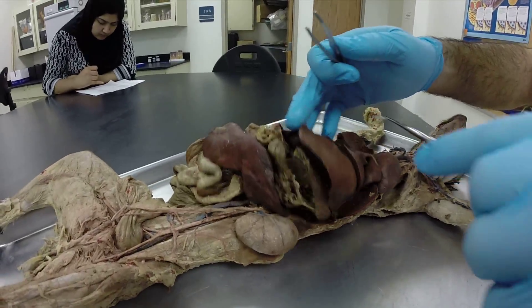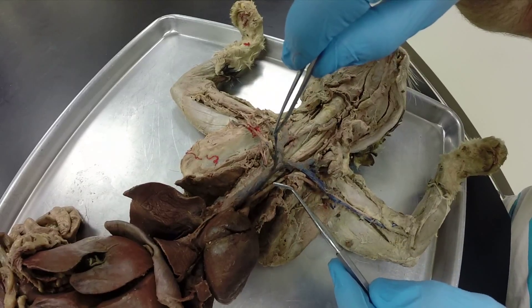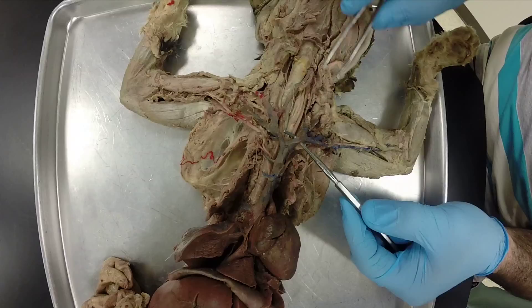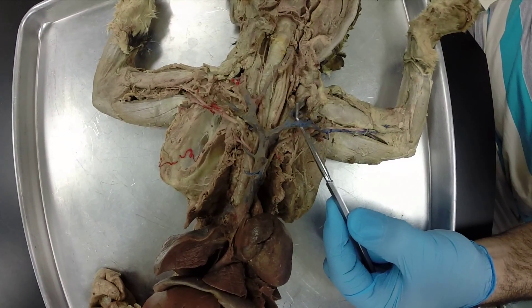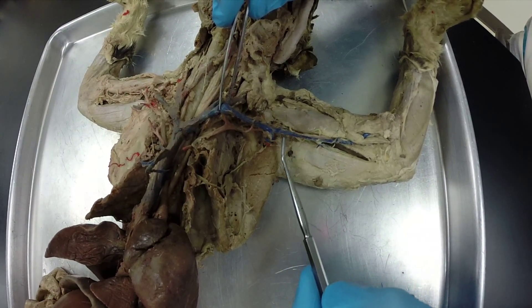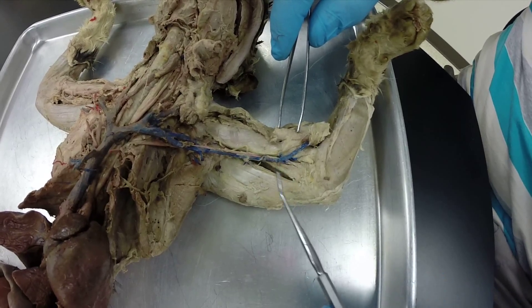Switching to the veins: this large vein anterior to the heart is called the pre-cava. We have a vessel coming perpendicular to it — this is the internal mammary vein. The pre-cava branches into the right brachiocephalic vein and left brachiocephalic vein. The brachiocephalic vein branches into the left external jugular and left subclavian vein. The left subclavian branches into the left subscapular vein and the left axillary vein, which continues out across the arm as the left brachial vein, then curves upward at the elbow and is called the median cubital vein.